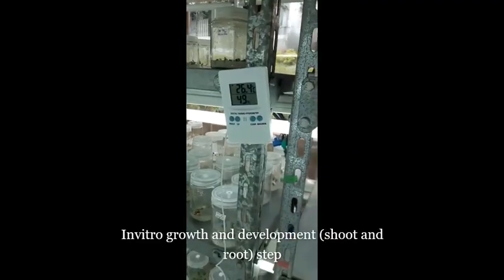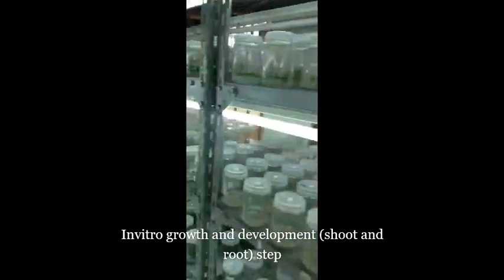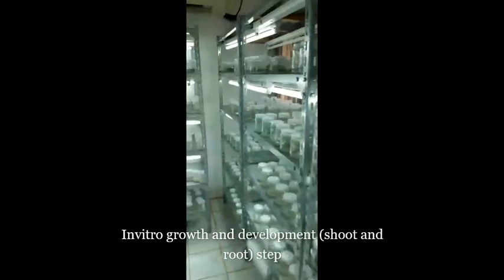This is our growth room. This growth room has light as well as temperature control. The temperature is 25 plus or minus 2, which is standard for environmental temperature, and the light is measured in lux, with 2000 lux provided for photosynthesis. As you observe here, plantlets grow from the embryos. These embryos are at the torpedo stage and cotyledonary stage. Those cotyledonary stages grow into plantlets after 2 months.